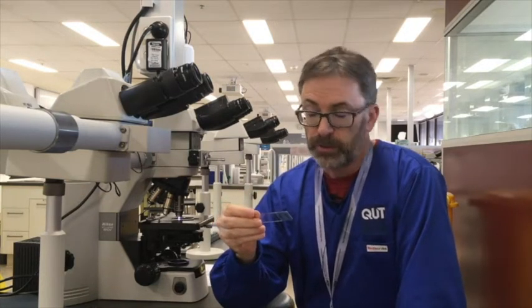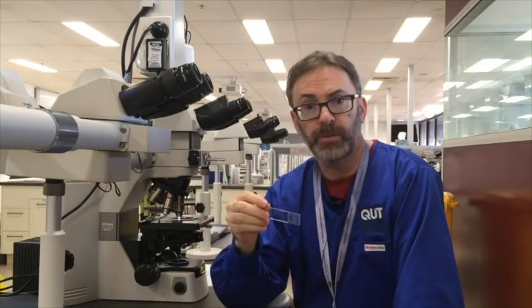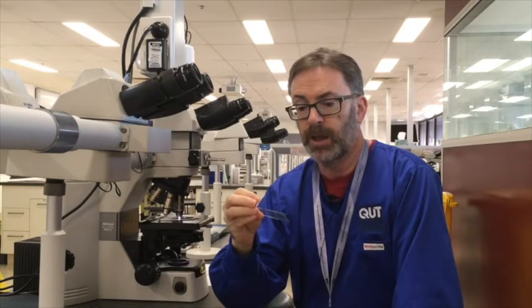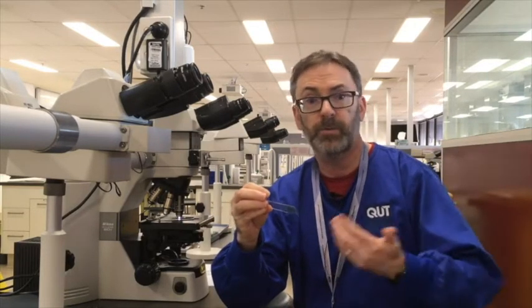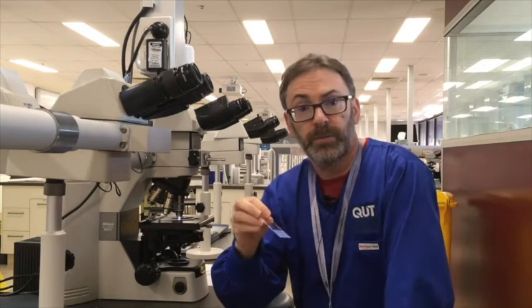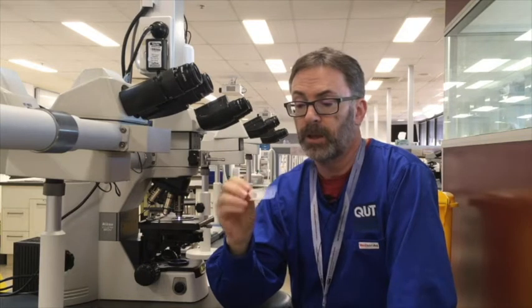So hematoxylin and eosin, how difficult could that be to get right? Well, as you'll see this semester, there are a variety of different methods for staining slides with H&E. You'll personally get to utilise three different recipes of hematoxylin, which all have their value for different applications. The standard hematoxylin recipe that we'll use, as in the case of a H&E stain slide, is called Ehrlich's hematoxylin.